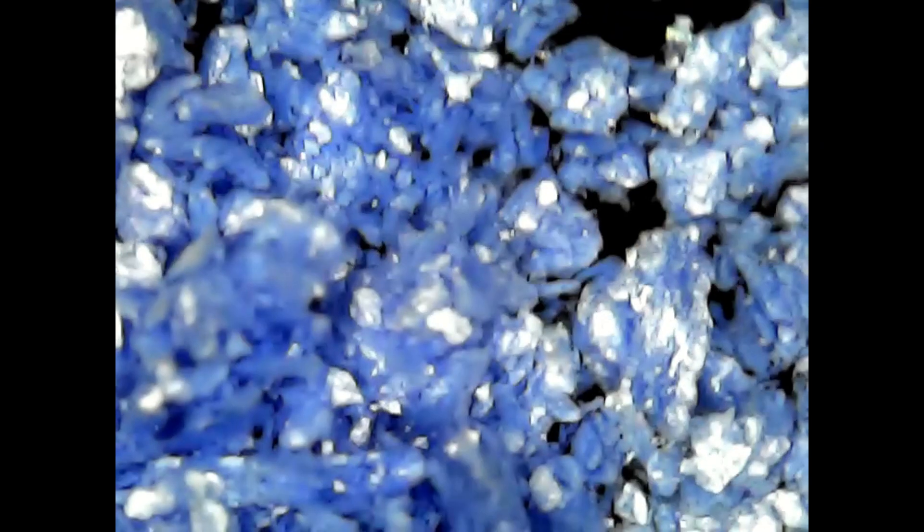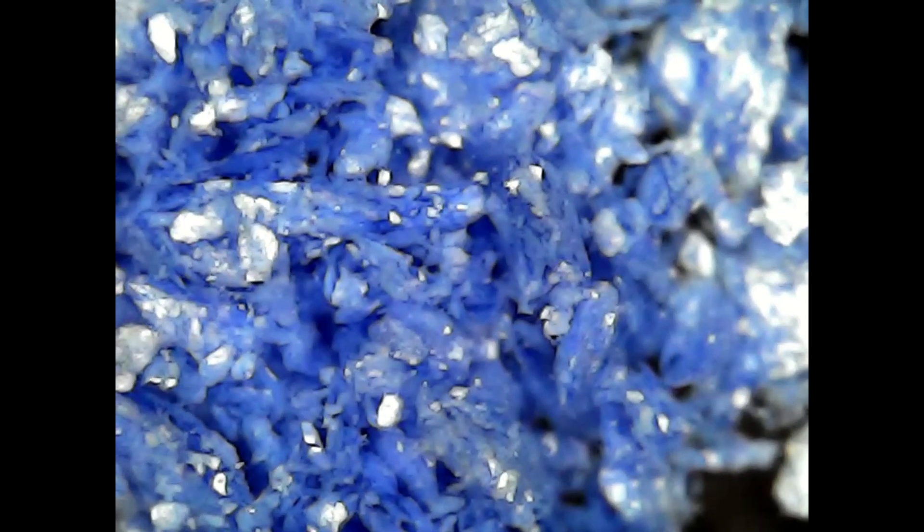Looking at the compound under the microscope reveals that no needle-shaped crystals are left. Only platelets, maybe, which are also pretty in their own right.